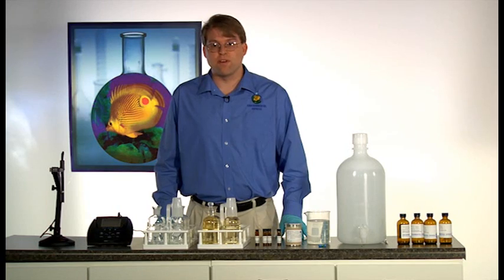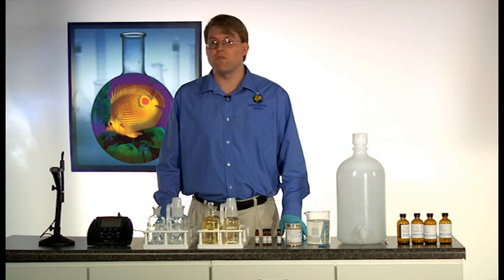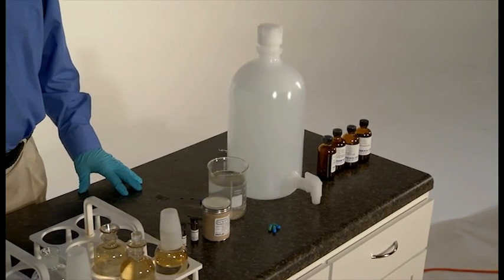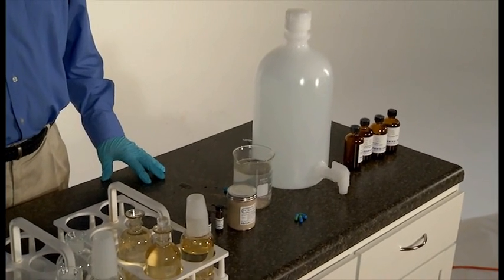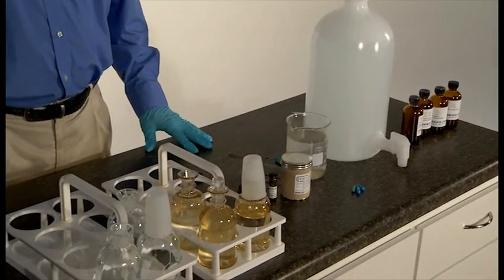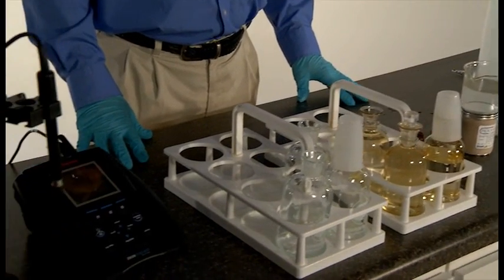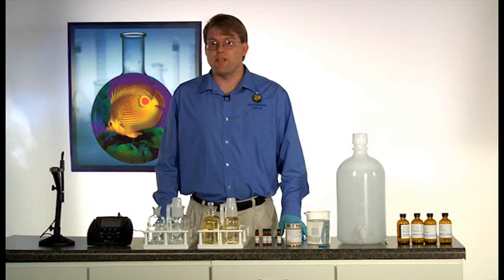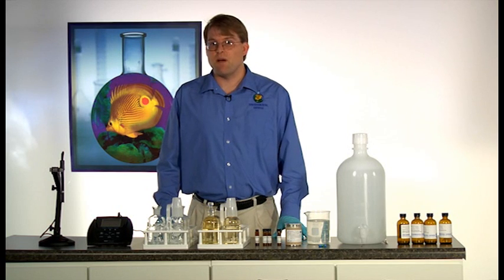Analysts who are familiar with their samples will be able to use as few as three dilutions. However, samples of unknown strength or that are highly variable may need more bottles in order to ensure an appropriate depletion. Add the appropriate amount of sample to each of your bottles and then top off with dilution water.